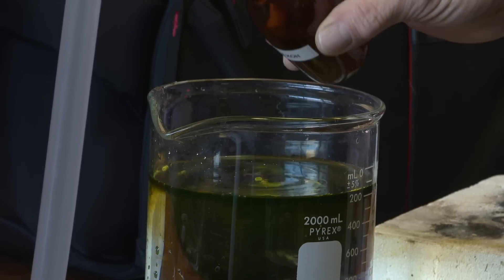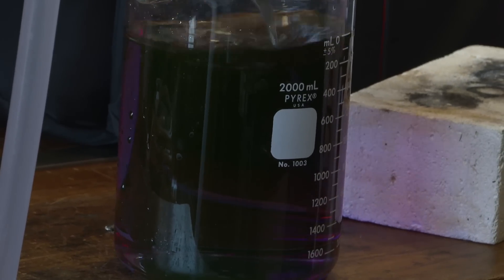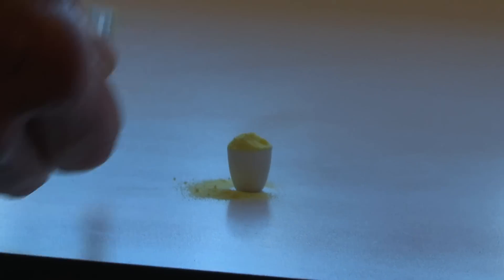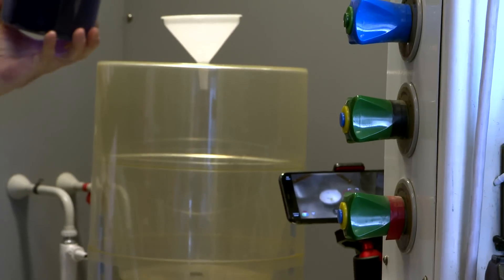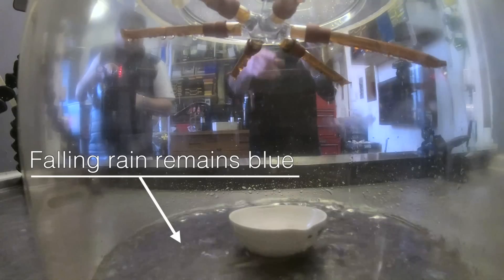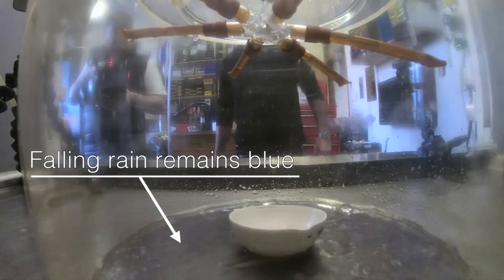He added a tiny bit of potassium hydroxide, which made it a nice blue colour, and if it goes acidic it should turn red. Run number one — Neil was unduly modest and put in just a little bit of sulphur. It rained, but no acid. So next time, Neil let himself go and put in a large amount of sulphur.